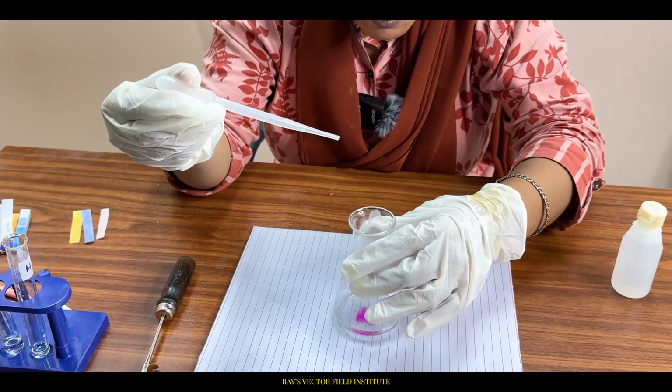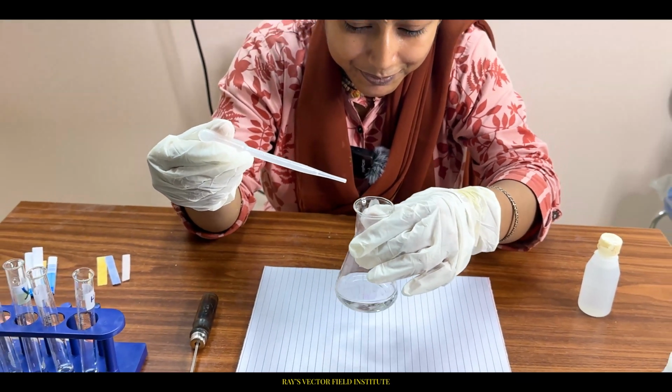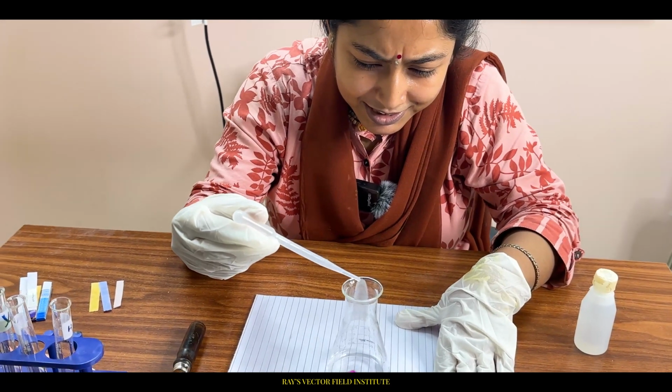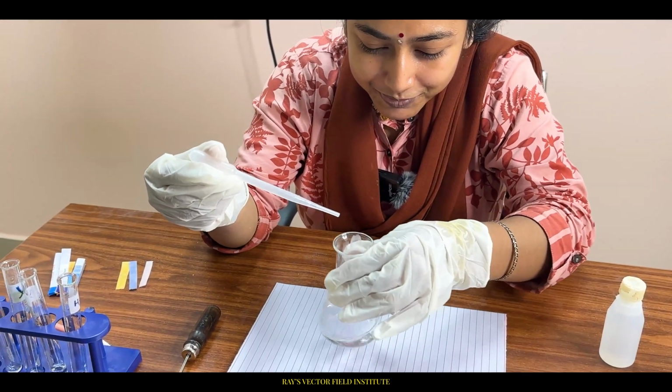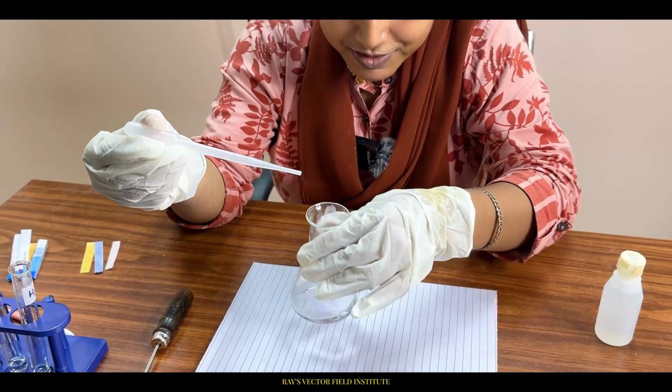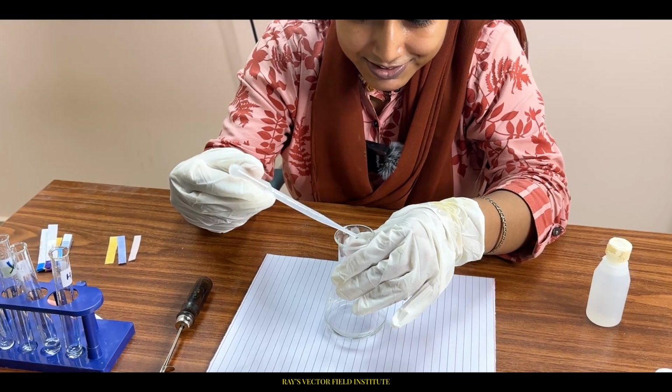See, color gone. Another drop, color gone. Another drop, color gone.